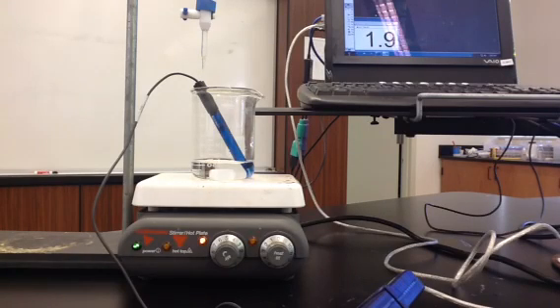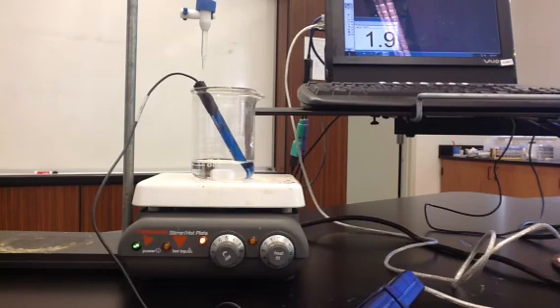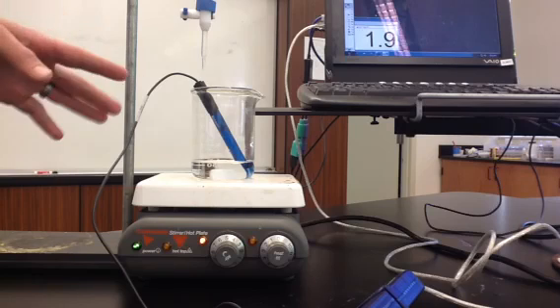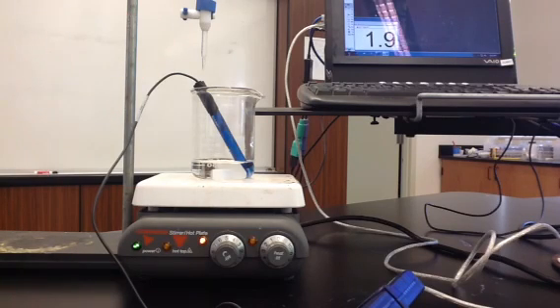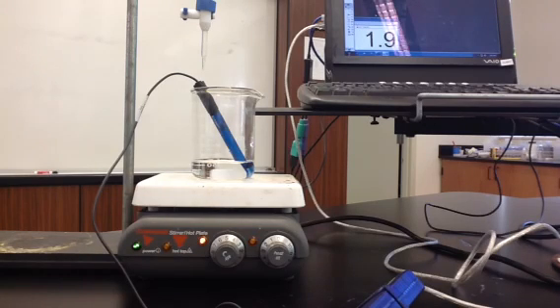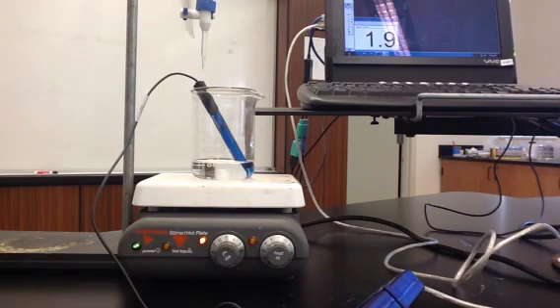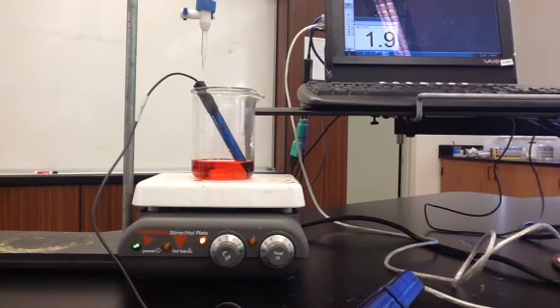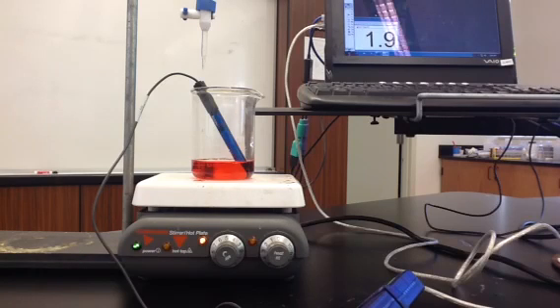This is the acid-base titration lab, where we're going to be making a titration curve for a titration of a strong acid with a strong base. In this beaker, I have hydrochloric acid. Inside of that, I have a pH meter and a magnetic stirring bar. You can see on the computer screen that right now the pH is 1.9. I'm going to add just a little bit of an indicator, which will help us see what's taking place during the titration. This is universal indicator, and it's red in a strongly acidic solution like the hydrochloric acid that we're starting with.